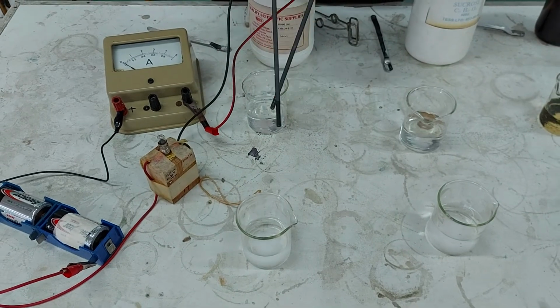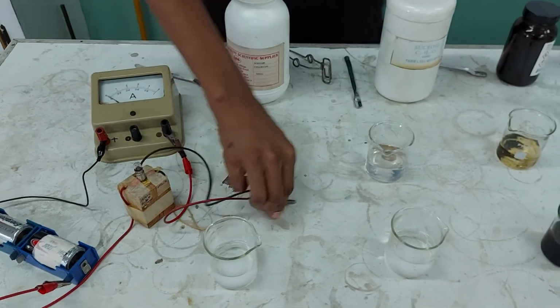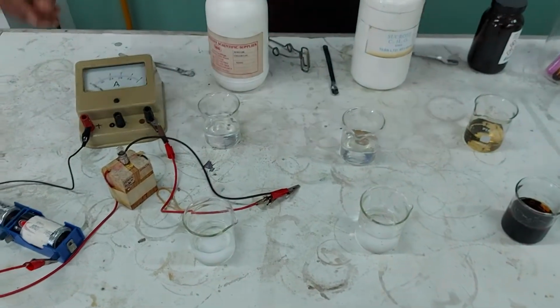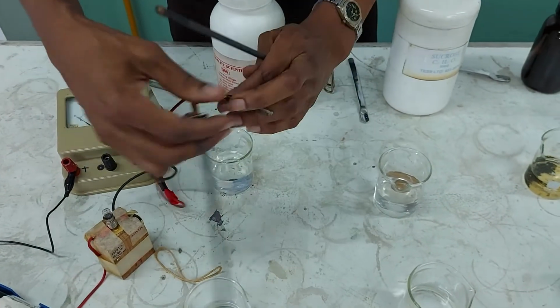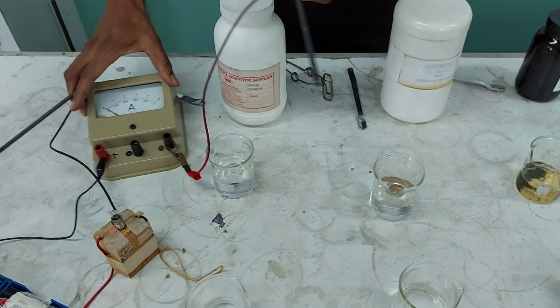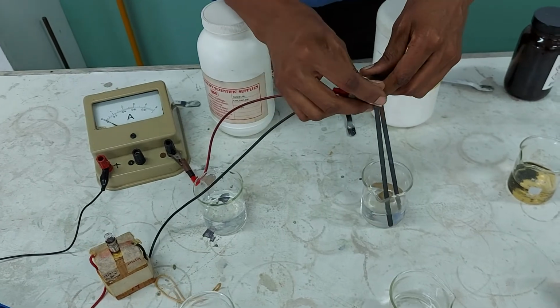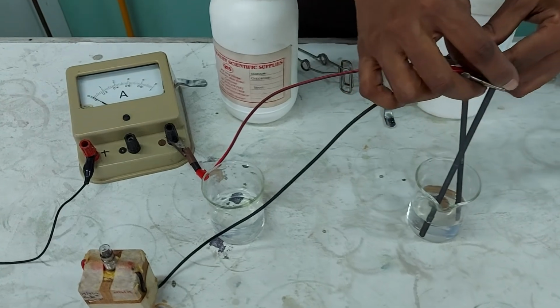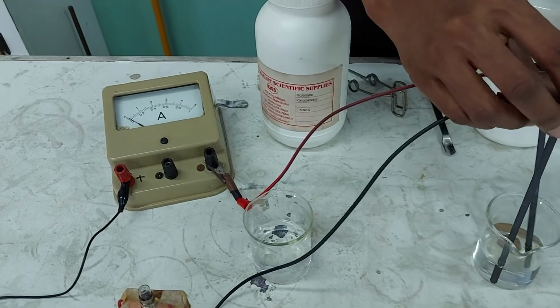Okay? I'm then going to move on to the next substance. I'm going to just give my electrodes a brief rinse while Miss is just recording what is going on there, a beautiful setup. And I'm going to come back here. And I'm going to try to see if I can get an ammeter reading for my sucrose in water. Okay, let's see. Sucrose in water. Wow, look at that. All right. Are you all seeing that? Sucrose in water. It's not looking too dramatic.